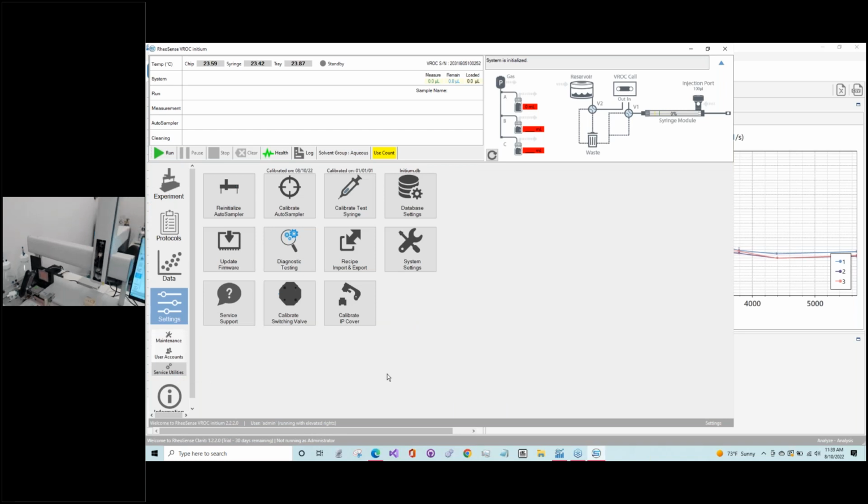So let me move the camera now that we've finished the auto sampler, so we can get back to the test syringe. And I will give it one more try to get our screw out. Hopefully it's not stripped, but I fear that maybe it is. I think it's been stripped there, so we need some pliers to get it out. But fortunately, because we have so many units in our lab, I pulled out a test syringe from the one behind me, which you can't see.